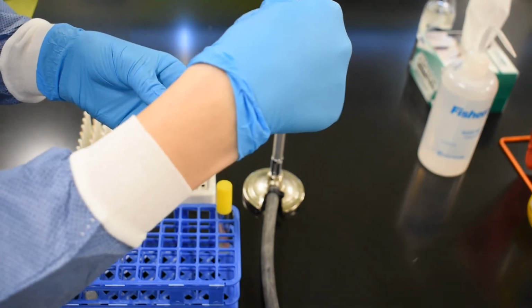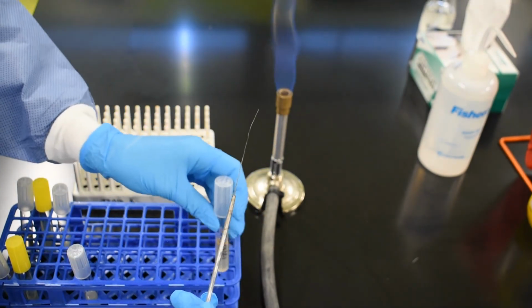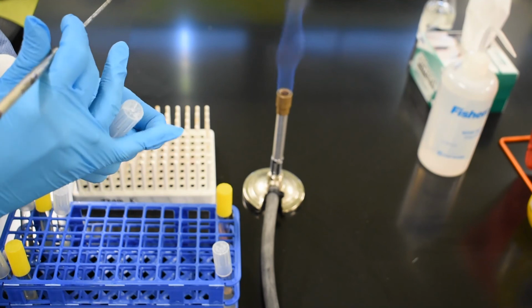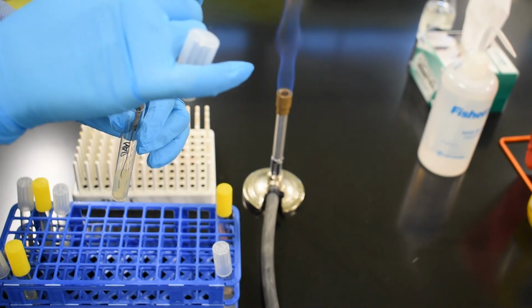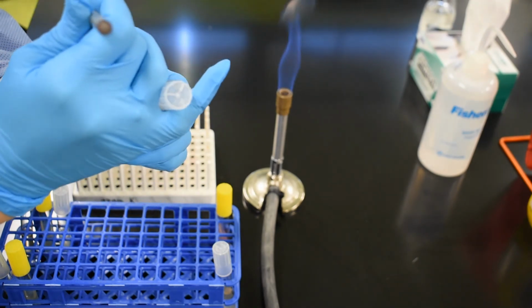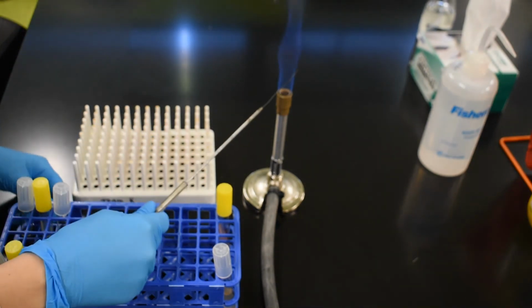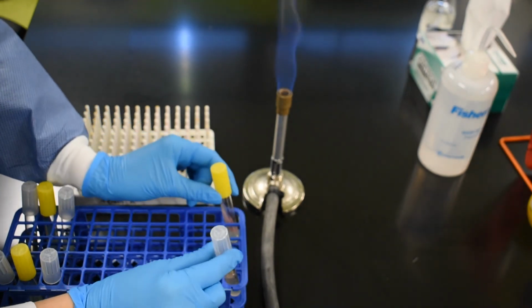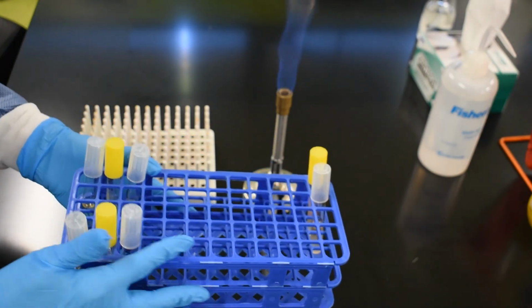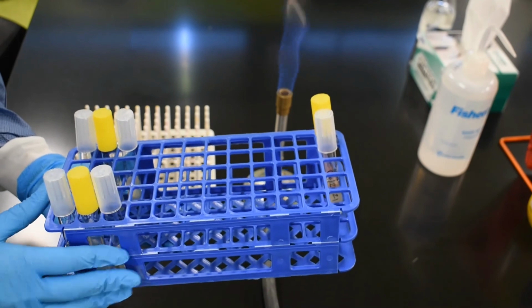We use the needle to pick up a sample of the broth and then we take that needle and we plunge it 2/3 to 3/4 of the way into the deep tube. After a final sterilization, the inoculations are complete. The stock cultures will be disposed of, and all 6 of these tubes will be incubated at 25 degrees Celsius for 24 to 48 hours before collecting the results.